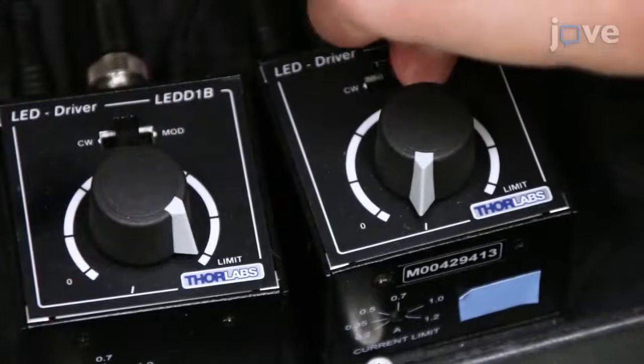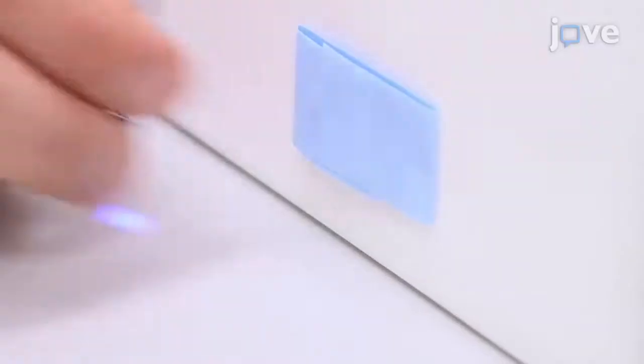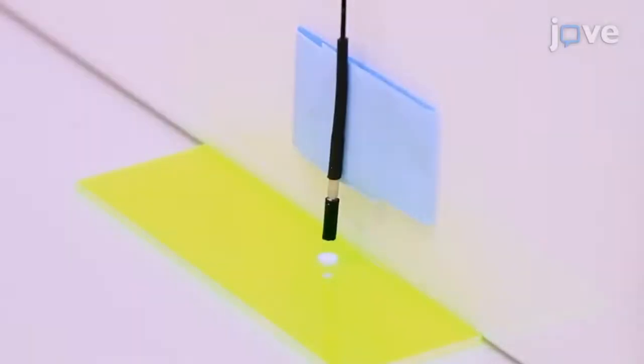Then turn on the 470 nm excitation light at low power and position the tip of the fiber pointing to an autofluorescent plastic slide.